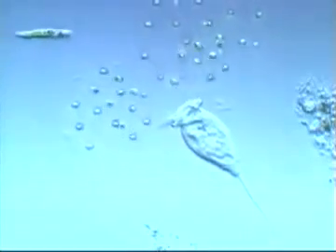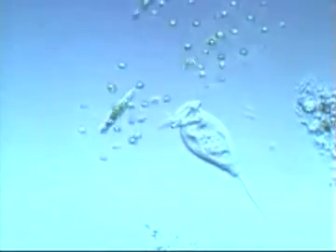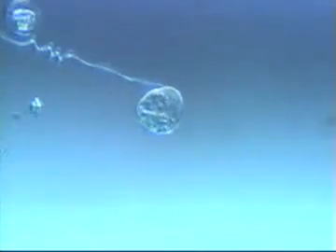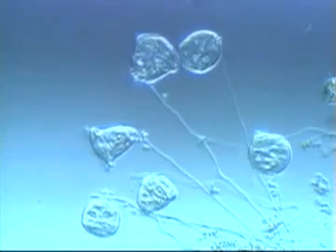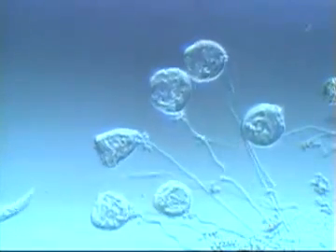The delicate Vorticella is another protozoan that likes to anchor itself to pond debris as it feeds. The cilia lining its mouth create twin currents, pulling in bacteria. Larger organisms like these green algae get caught in the current as well, but are not consumed. Vorticella have coiled stalks which they can extend and contract quickly. They often appear in a cluster and seem to take turns extending and contracting.